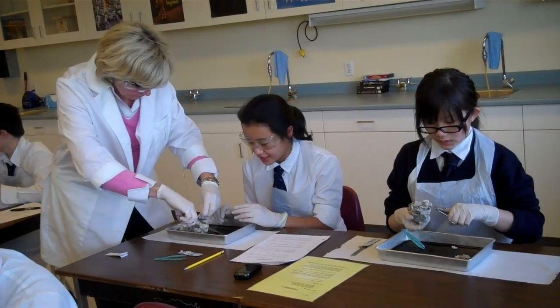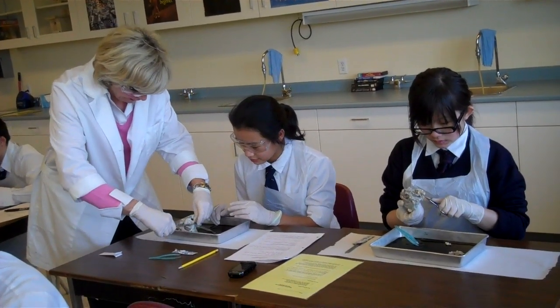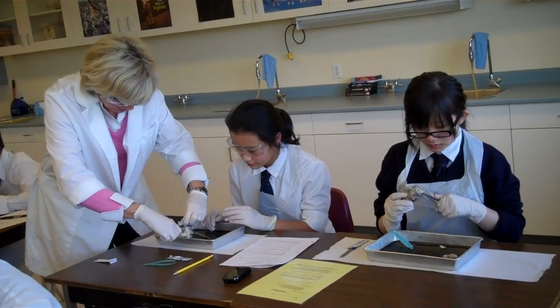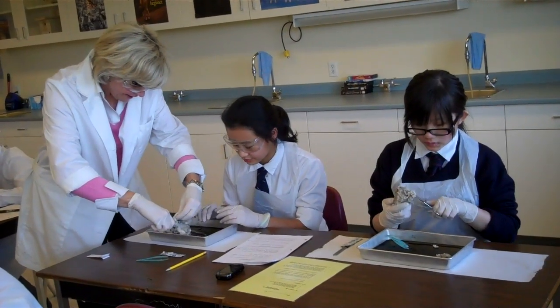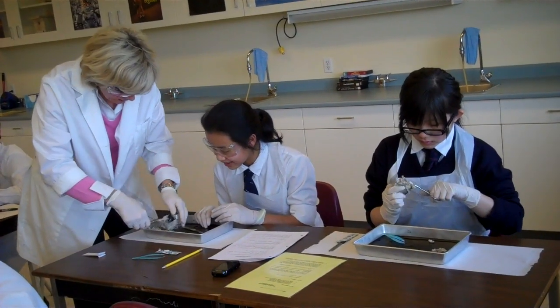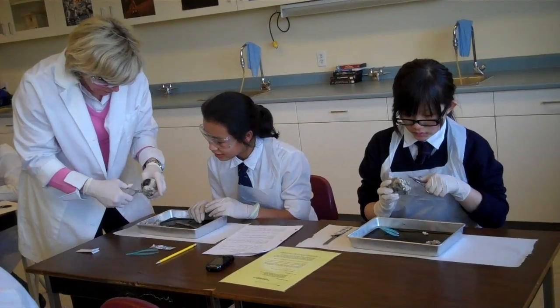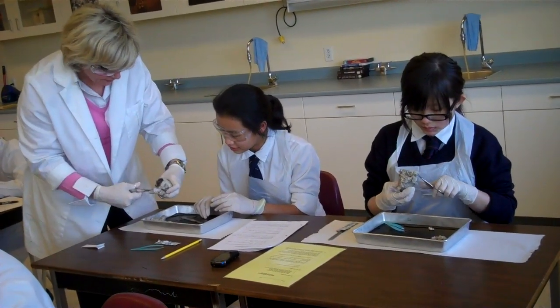Oh, you've got a great opportunity. It's coming out. Let's just cut, let's just get rid of this. You've got kind of an interesting eye. It's kind of a bit of fat just around it, but I think it's only just because it's been in the preserving, you know.